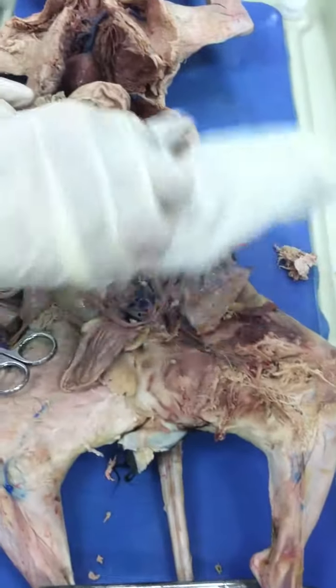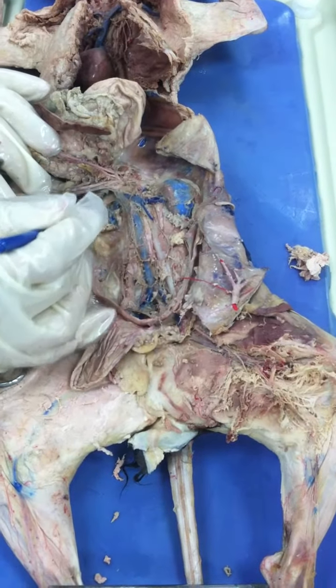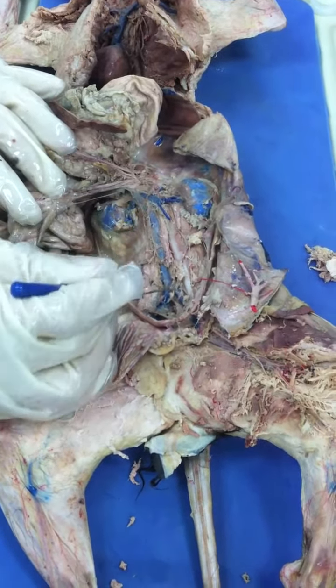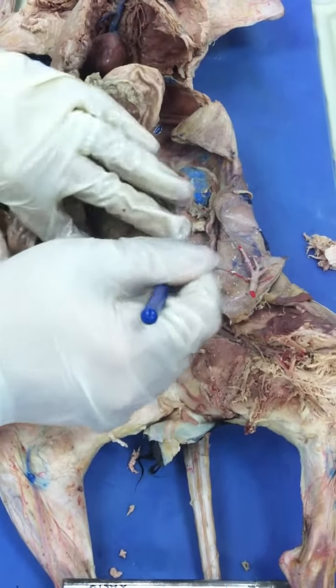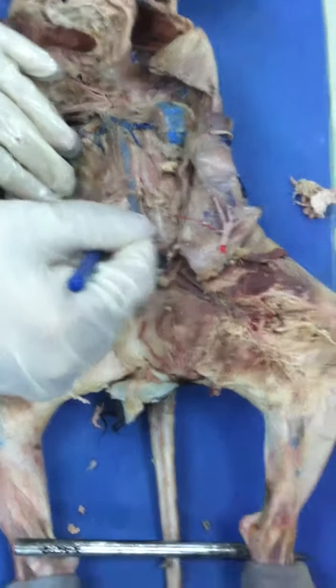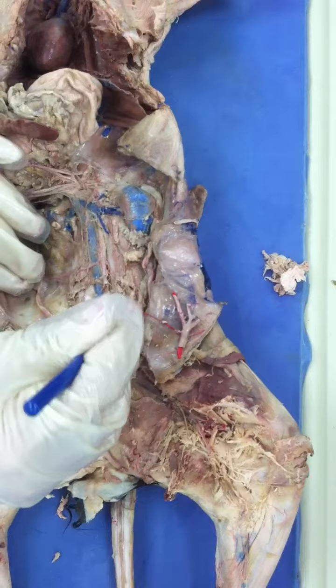So we continue to follow the inferior vena cava. All this that you see is the inferior vena cava. You see it? All this. Now, if you notice, it comes to a point that the inferior vena cava gives me this branch. This is going to be the right iliolumbar. The left one went to a better place. But anyway, it's a little bit here.